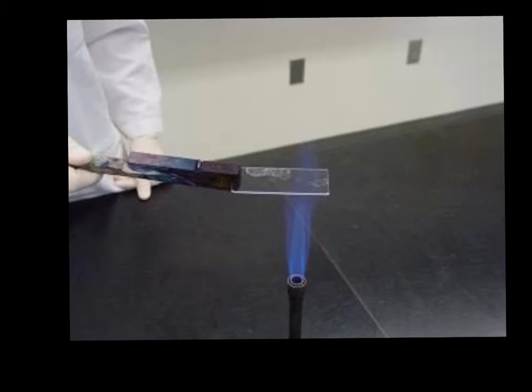Now the bacteria is safe for us to follow the steps for staining for whichever type of stain we choose to use. You can look at our various types of staining techniques on my gram stain video or my simple staining videos.